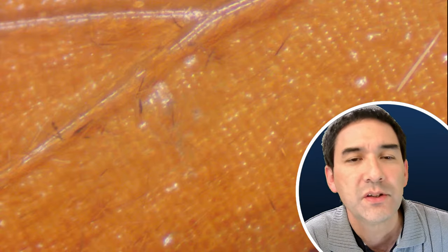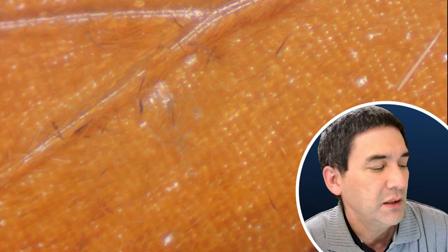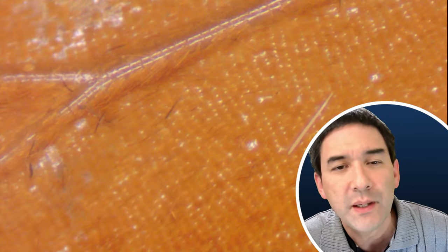There's an automatic exposure setting, and as you can see the camera tends to overexpose. If we go to where the wing is a little bit darker and zoom in, we should be able to see the individual scales. Honestly, I'm not happy with the quality here. I think the contrast issue is because of the glass on the surface and its reflections.